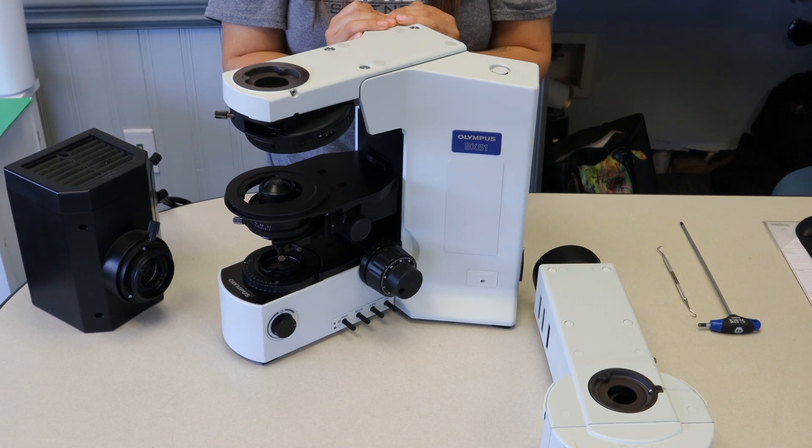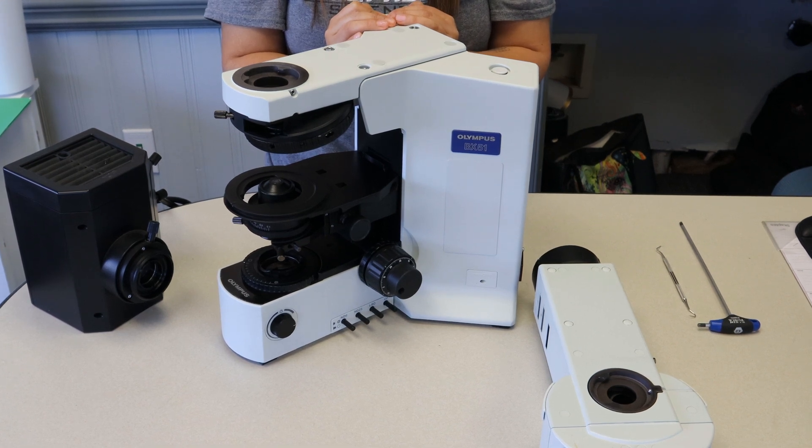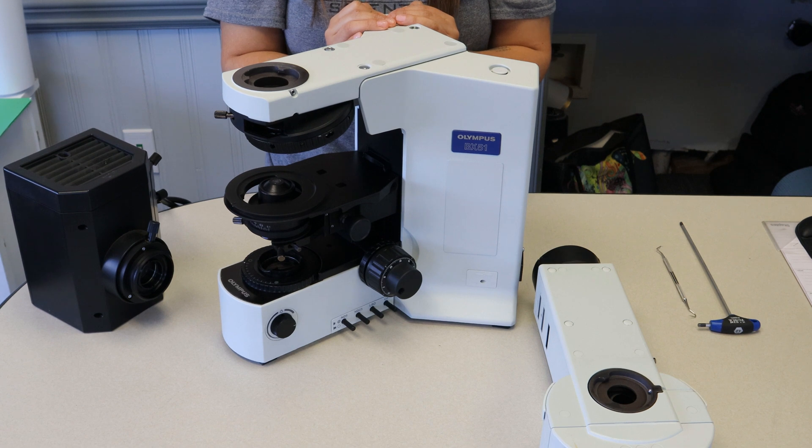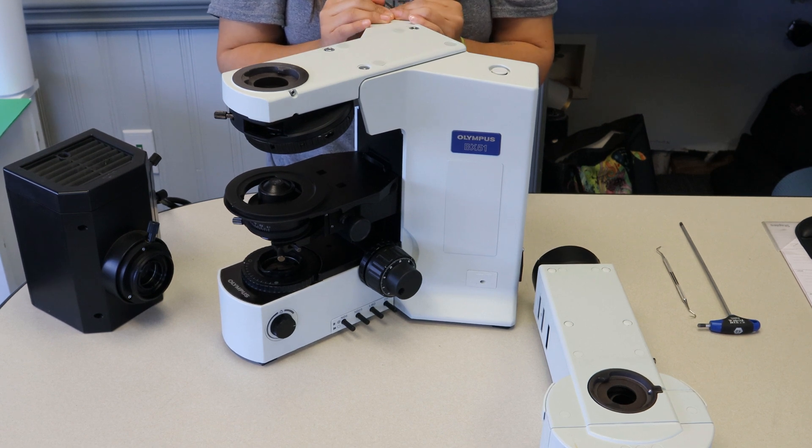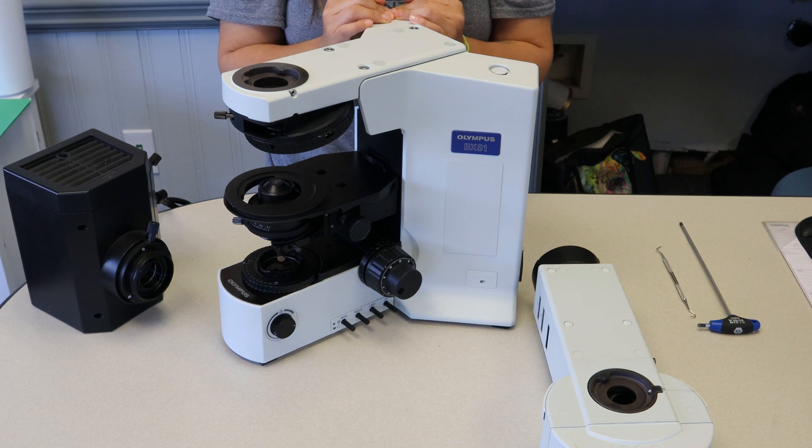Hi everyone, this is Walker from the Scientific Instrument Service, and today we're going to be showing you how to add a fluorescence attachment to your BX-series microscope. Maria's going to be giving me a hand, pointing out what implements you need, and going over the procedures with us.